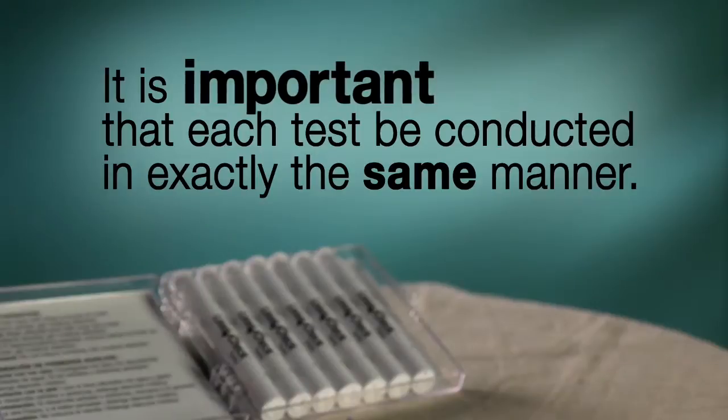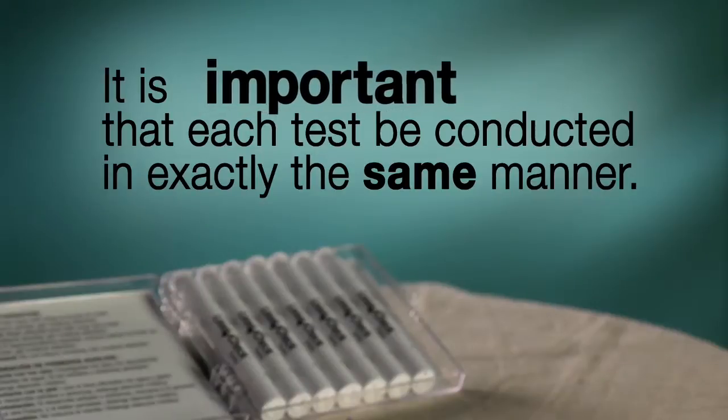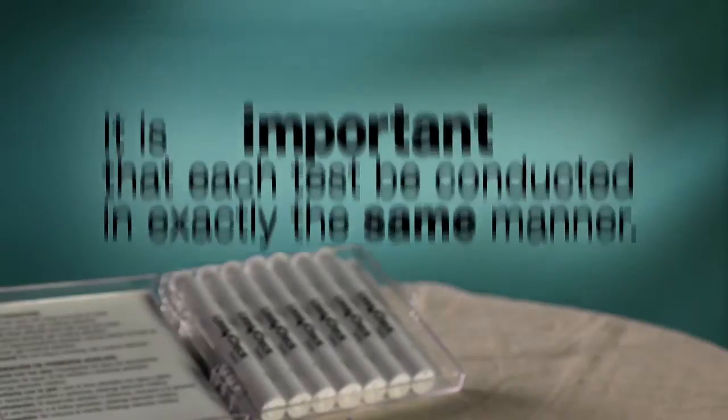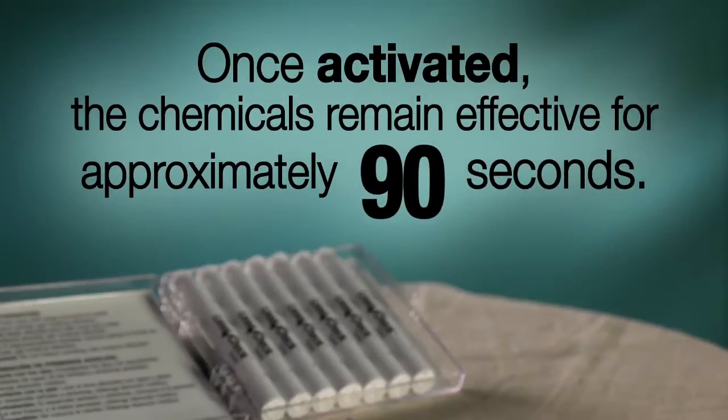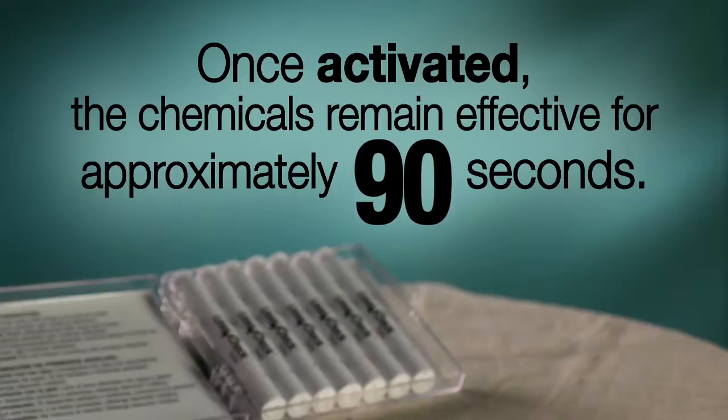It is important that each test be conducted in exactly the same manner. Do not squeeze the 3M LeadCheck swab until the area to be tested has been prepared. Once the chemicals inside have been mixed and activated, they remain effective for approximately 90 seconds.